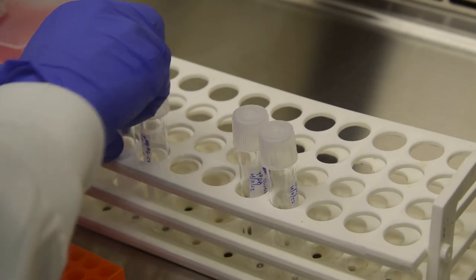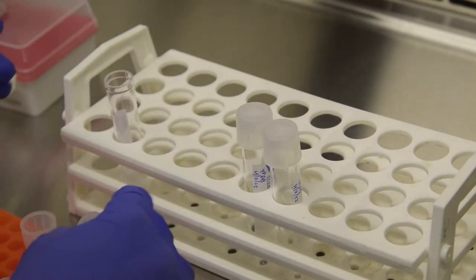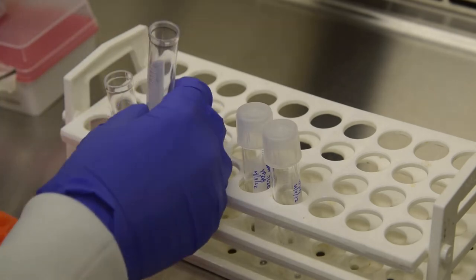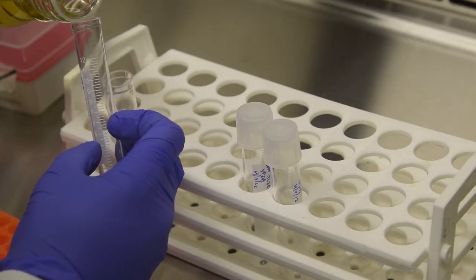The plasmids I am using can be found in the video notes. We are going to begin by filling culture tubes with approximately 6 mL of the appropriate media. Label tubes before filling or label with tape later.